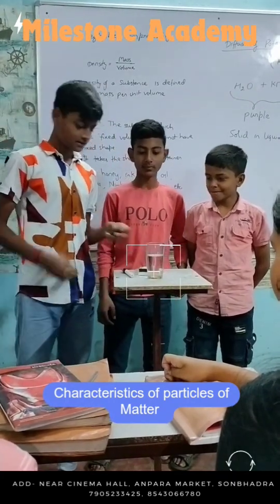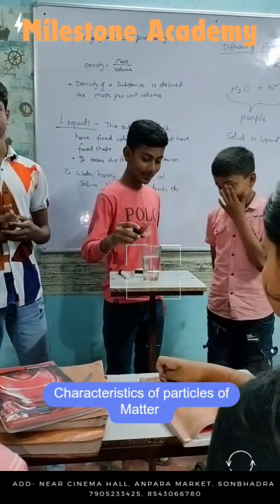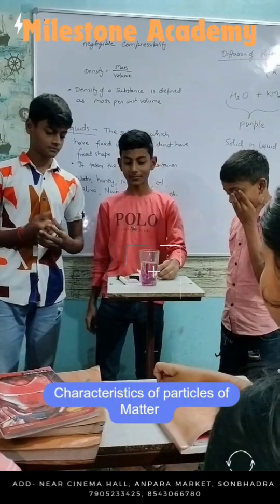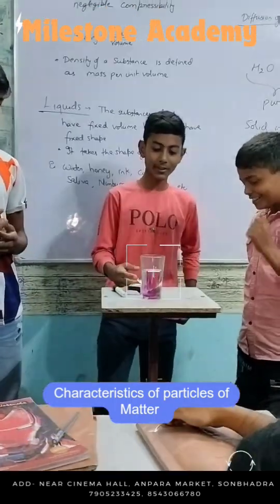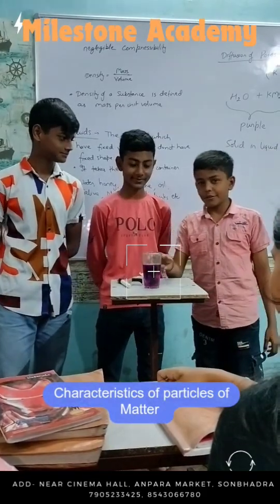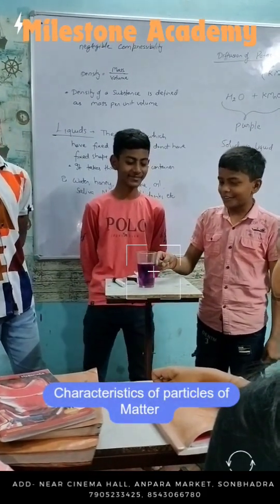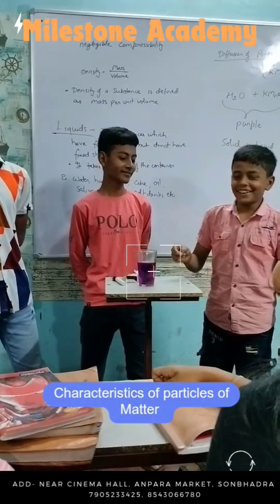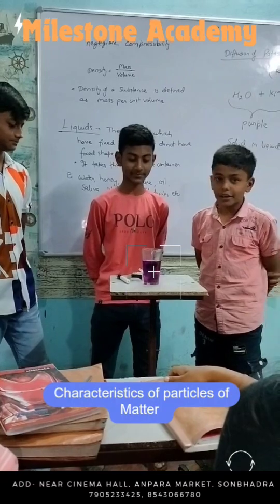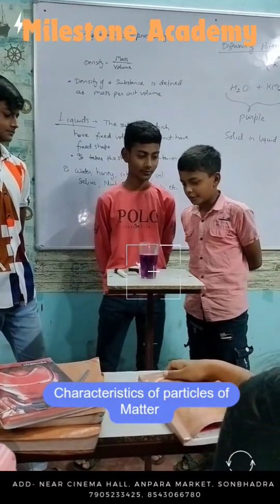Now we will show you how potassium permanganate diffuses into water. When we add potassium permanganate in water, we see that the particles of water are continuously moving slowly. When we add potassium permanganate into water, the color of the water gets changed — into pink.